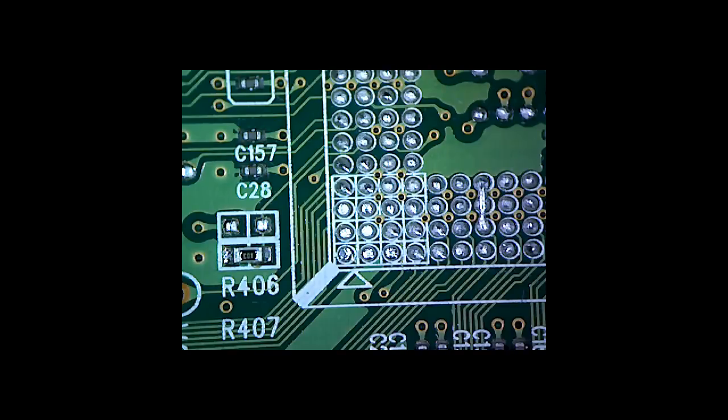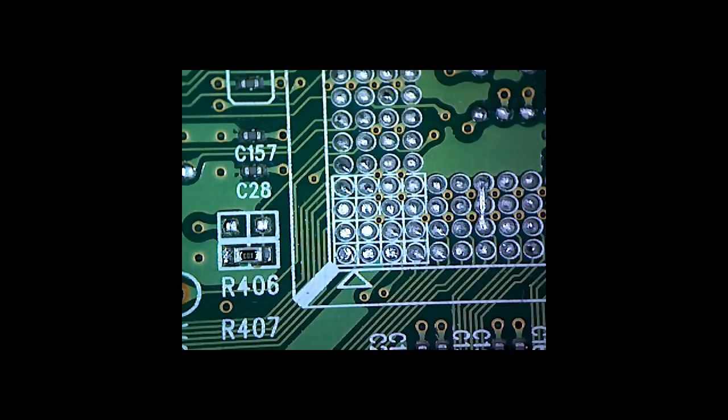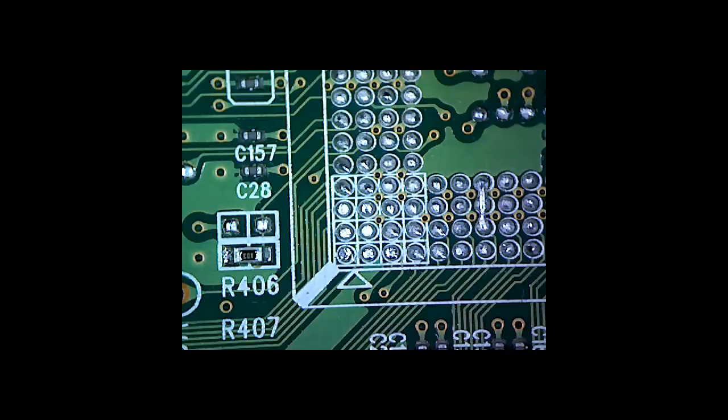What I was going to do was adjust the exposure and some of the other settings just so you can see the top of this come into view properly. So it looks like I'm going to have to show you parts of this board and then go and make some changes.